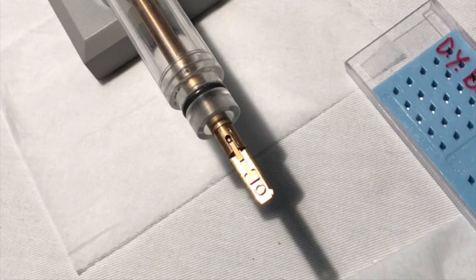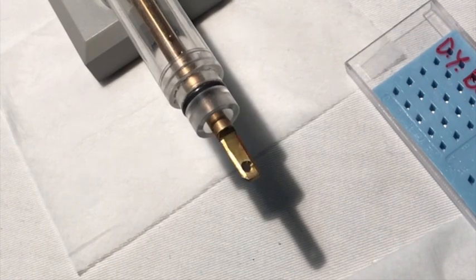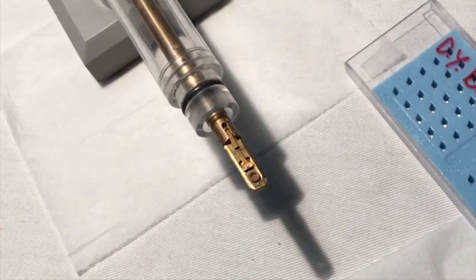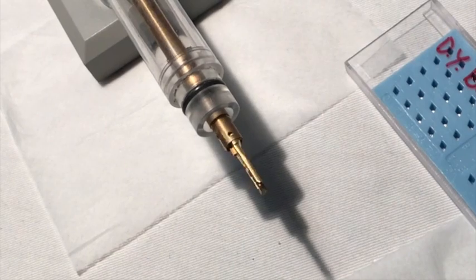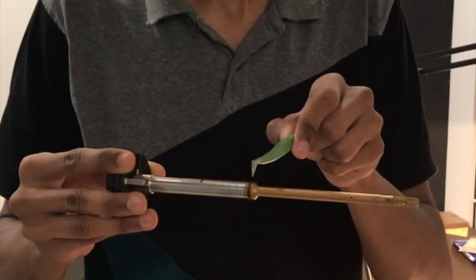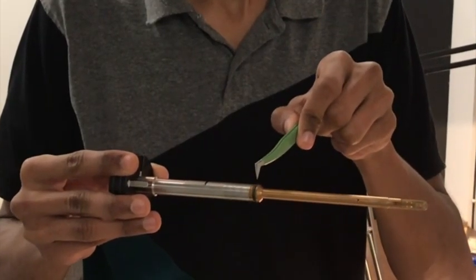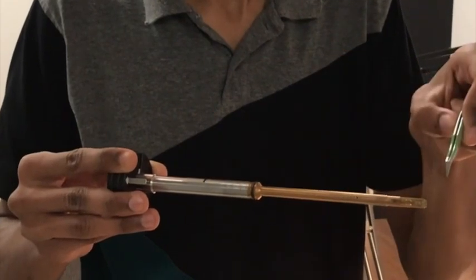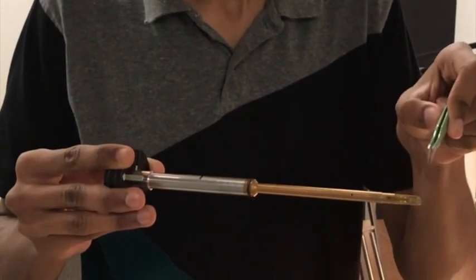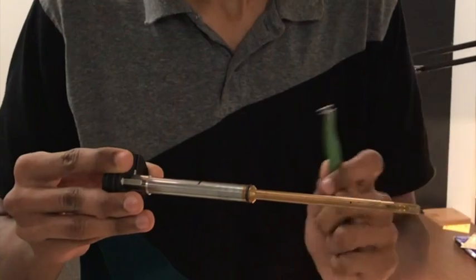It's always safe to tilt the specimen holder to make sure the specimen doesn't fall off. This is the O-ring of the TEM holder. Anything beyond the O-ring will go into the TEM, so do not touch any part beyond the O-ring.